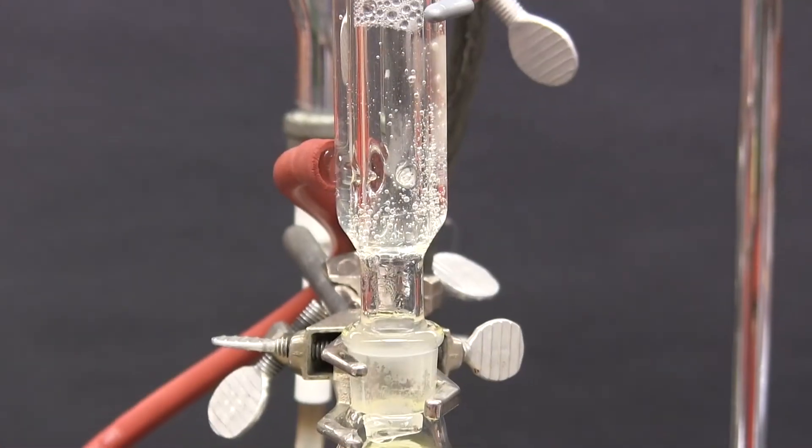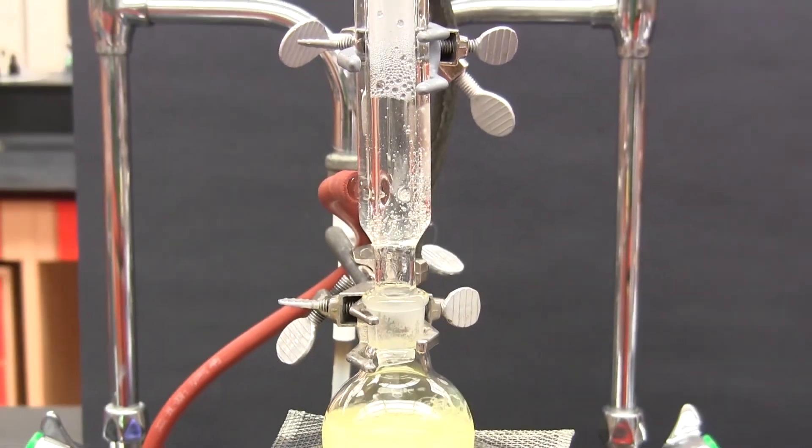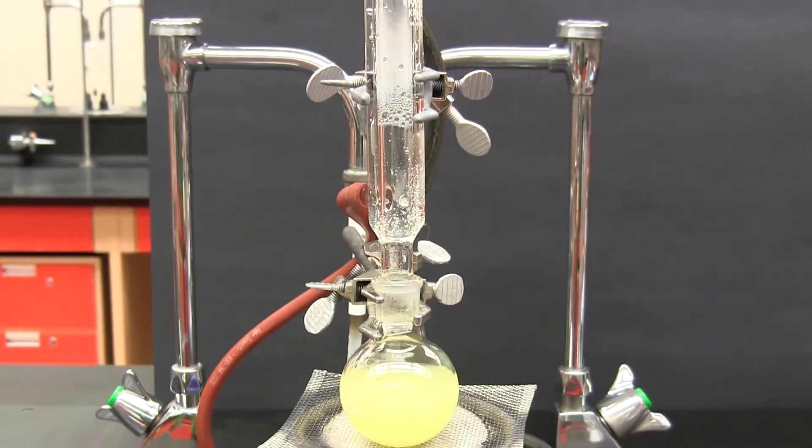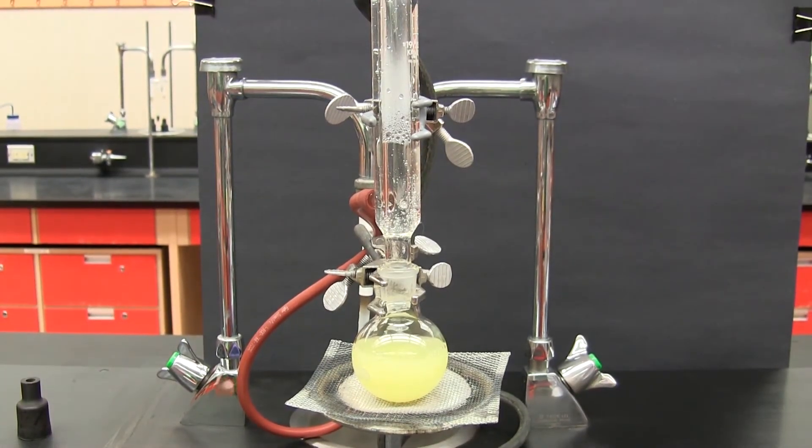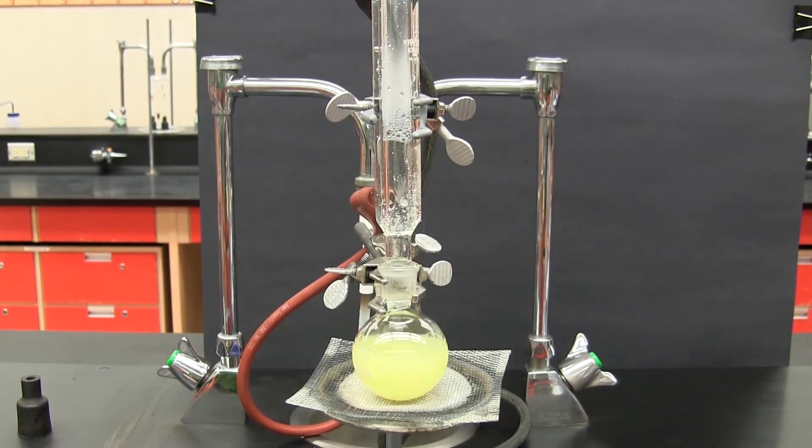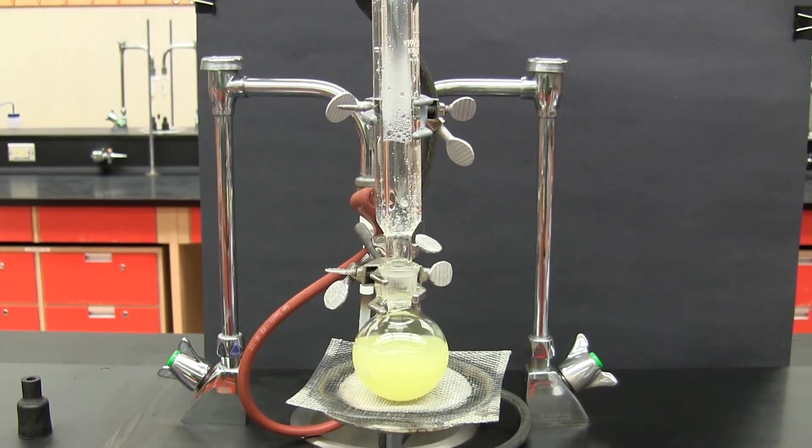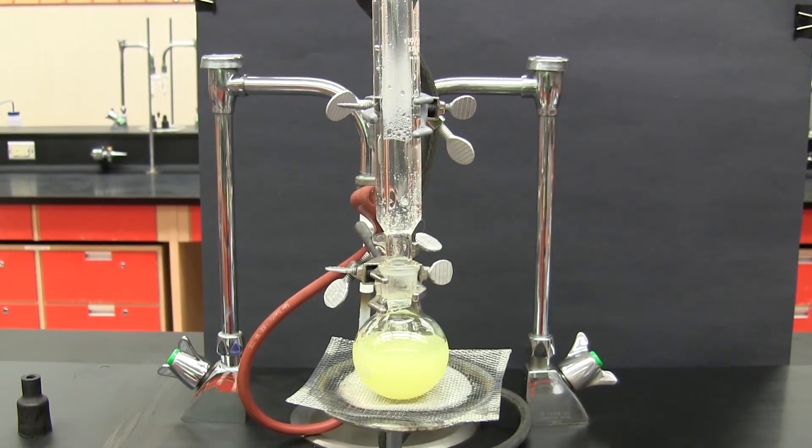The reaction mixture is now being heated under reflux and this can continue indefinitely as long as the condenser is kept cold by the continuously flowing cold water. No solvent will be lost, it will be constantly recycled.